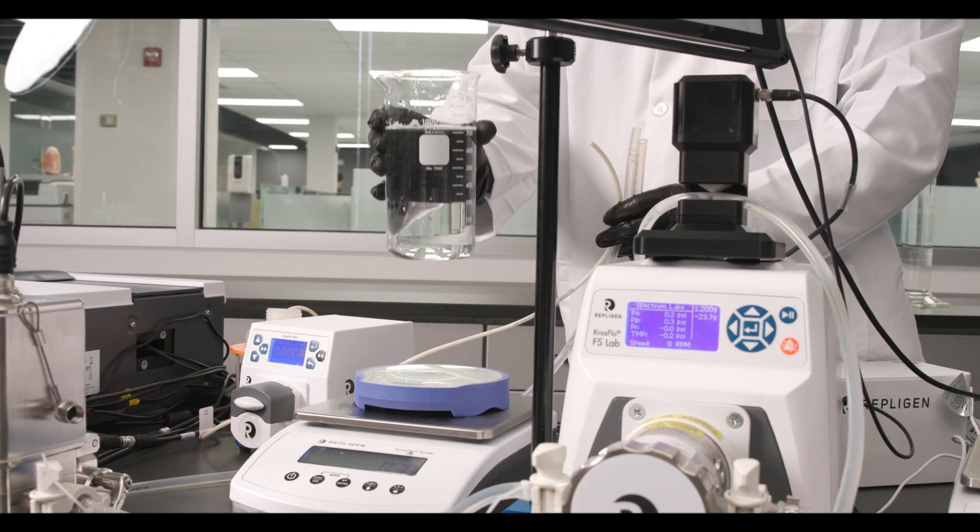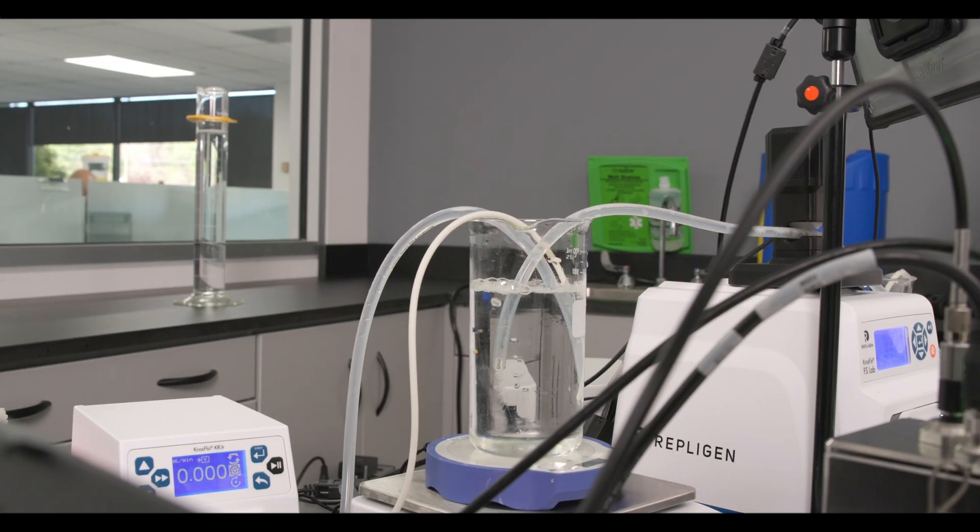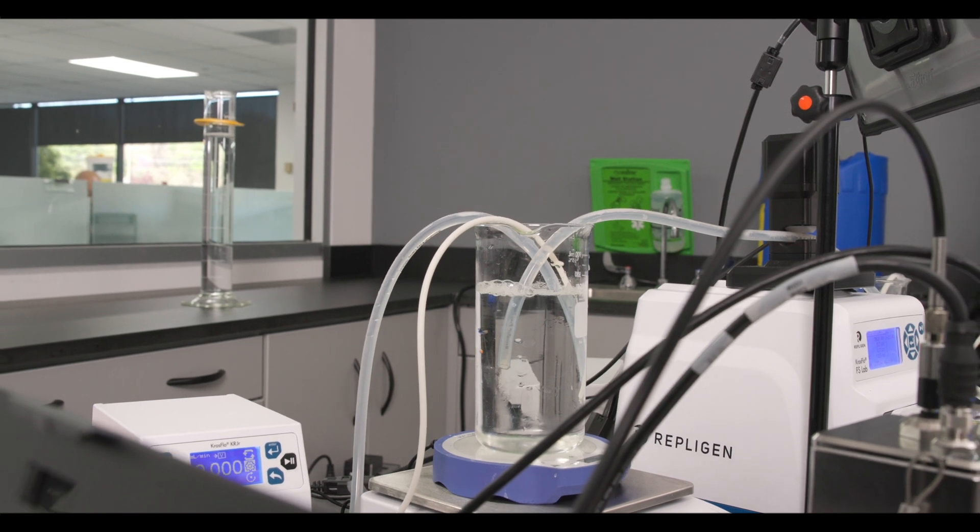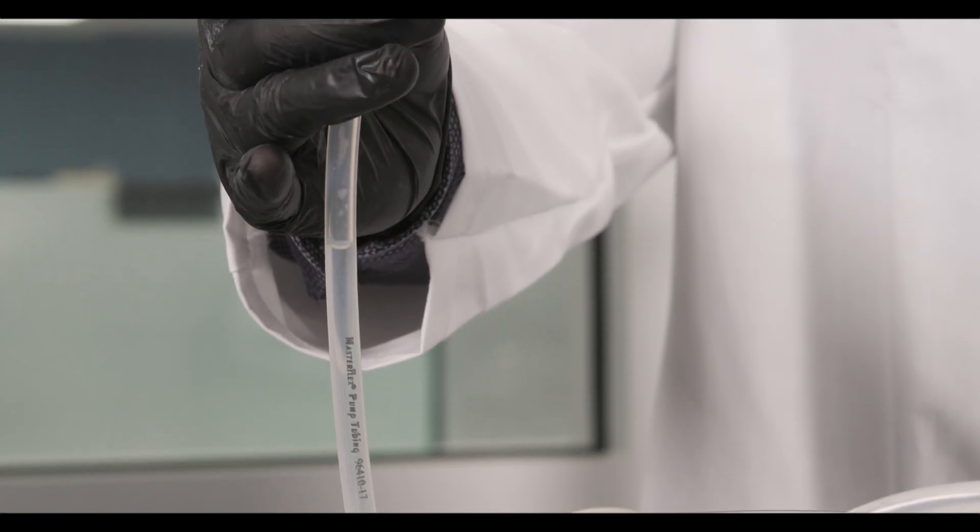After you've completed the process run and flushed your solution, we recommend running 0.5 molar of sodium hydroxide through the CTEC FlowVPX and flow cell for a total of 30 minutes. Then flush with water and leave the system and flow cell dry.